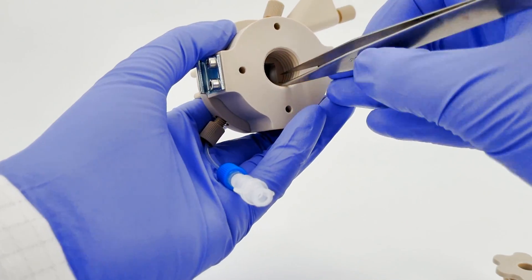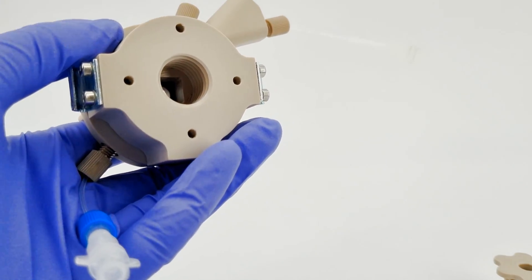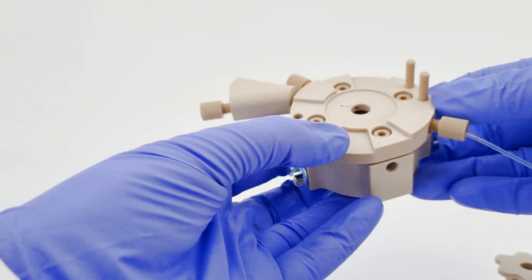If you notice any corrosion on the copper piston, simply repolish it to return it back to its pristine condition.